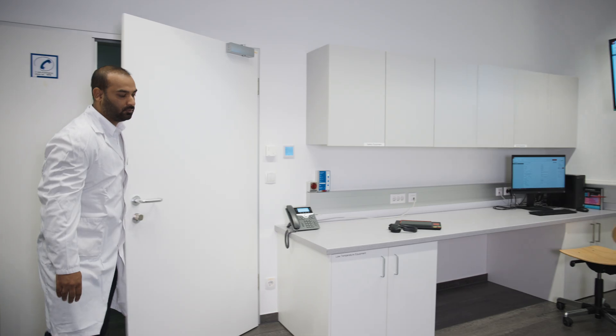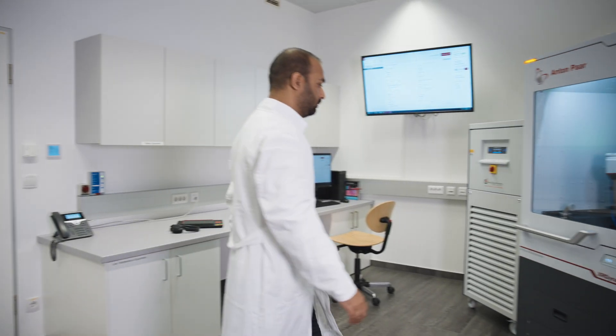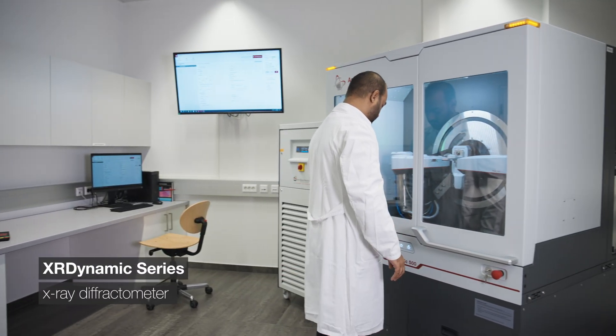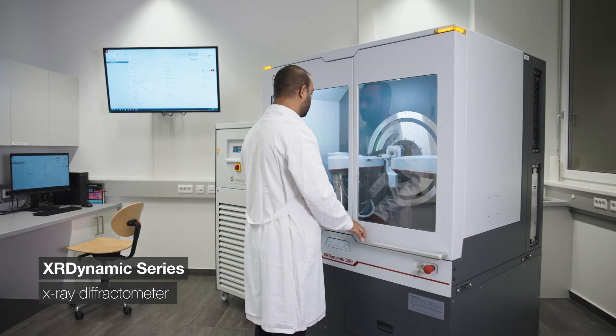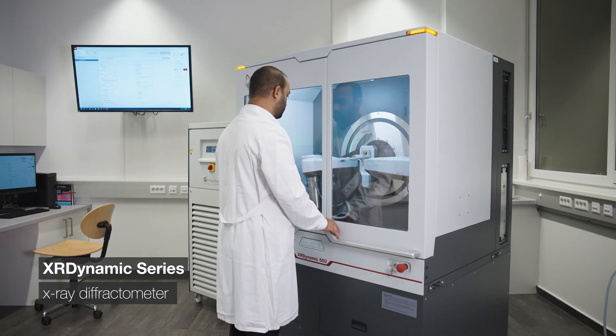X-ray diffraction, or XRD, is usually the technology of choice. It can be used to get information on the crystal structure, crystallite size, and phase purity of electrode powders.